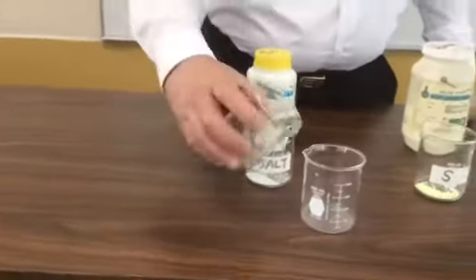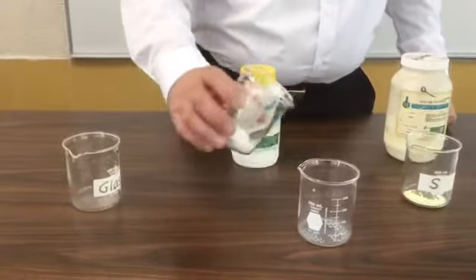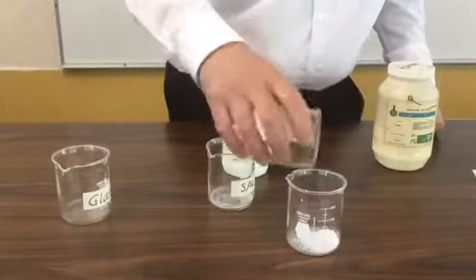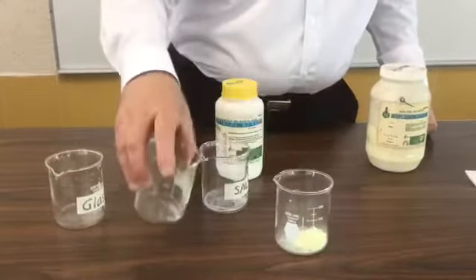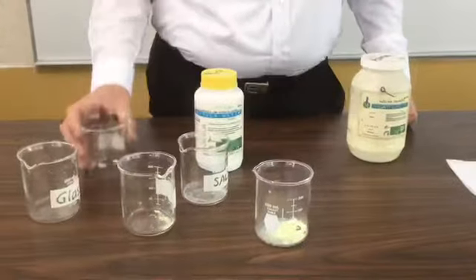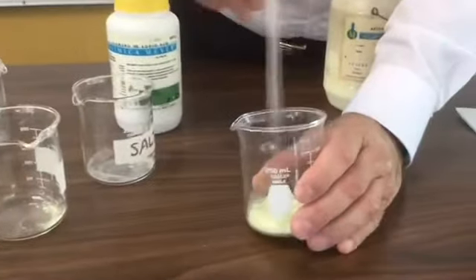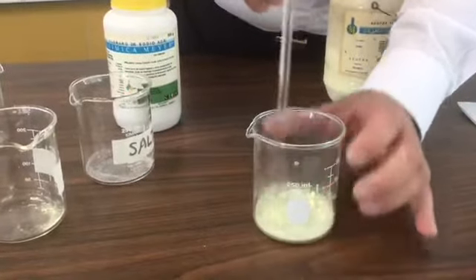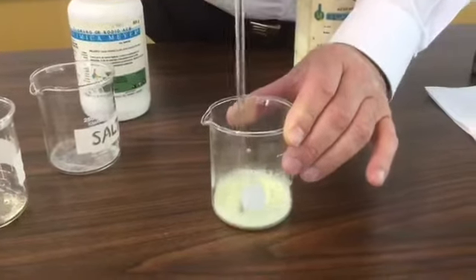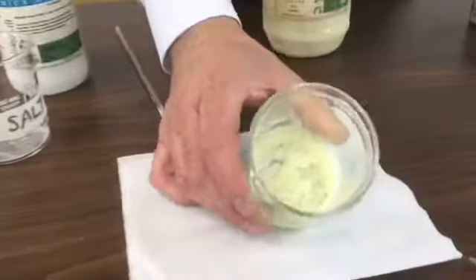First, I am going to pass the glass spheres to a beaker. Next, the salt, the sulfur powder, and finally the iodine particles. Let's mix perfectly to incorporate all the ingredients in our mixture. And as you can observe now, they are very complicated to separate.